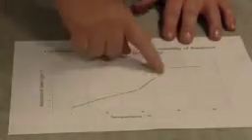So if we have a little think about what could be happening in this kind of temperature range here, probably what is happening is that the proteins in the membrane are now starting to become denatured, and the membrane is starting to fall apart here. So all of the anthocyanin is leaking out.